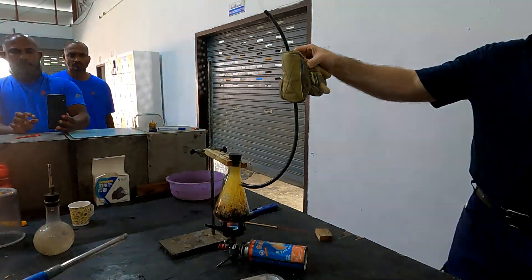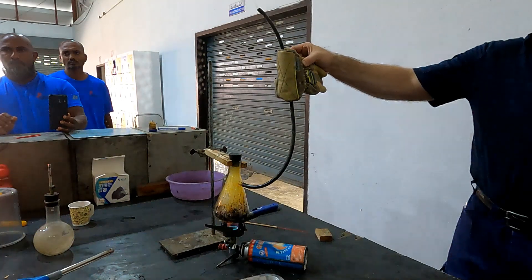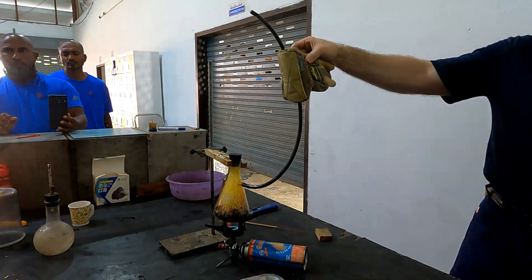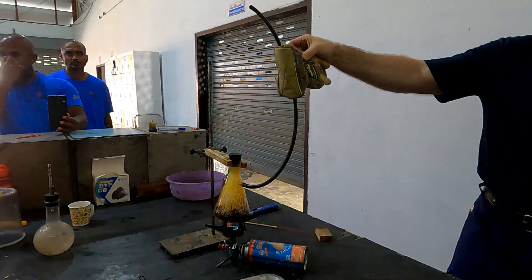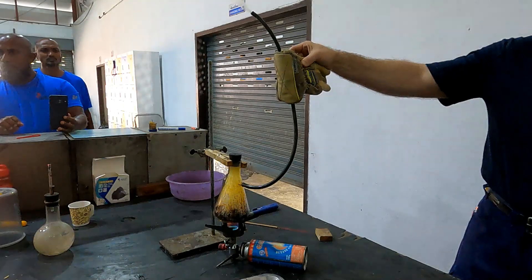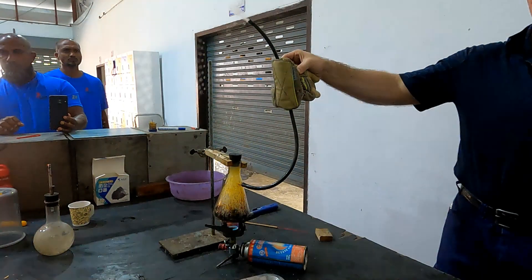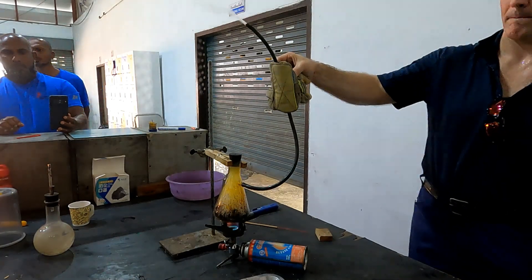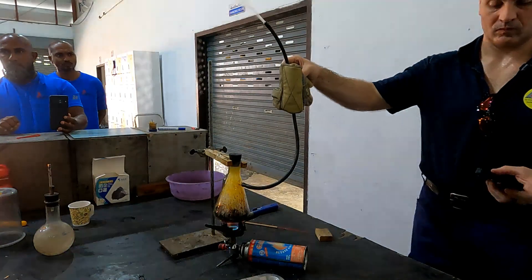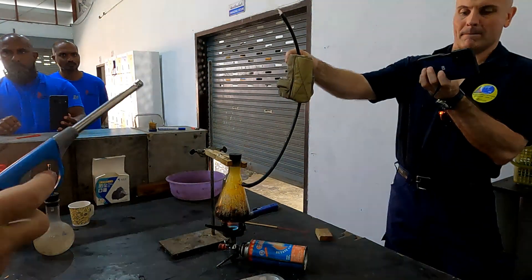But remember, at the moment we're just taking that solid fuel and converting it to a gaseous fuel — we have to put energy in. If I take the Bunsen burner away, everything stops. It's not self-sustaining. That other process is self-sustaining — it's giving me a lot of energy back. This one is giving me nothing back yet, until I ignite that smoke.